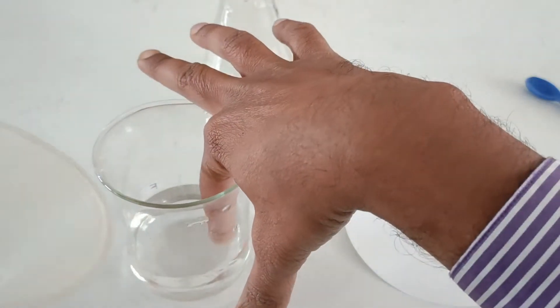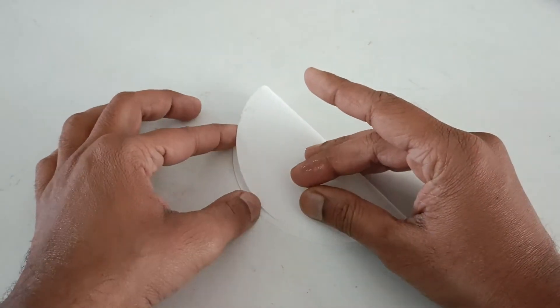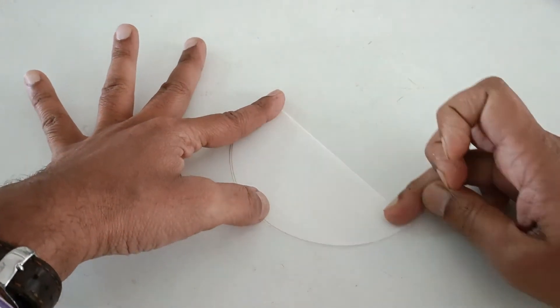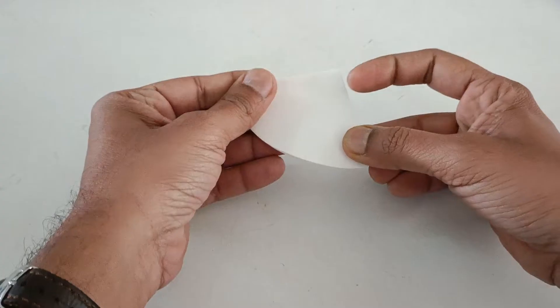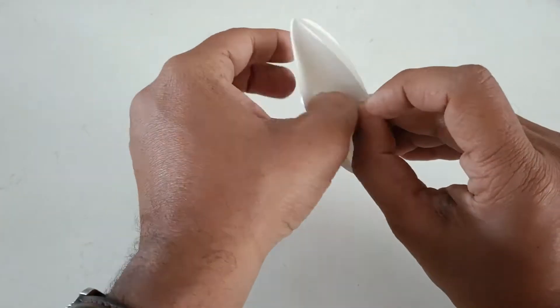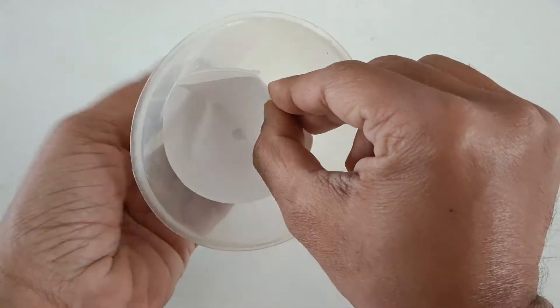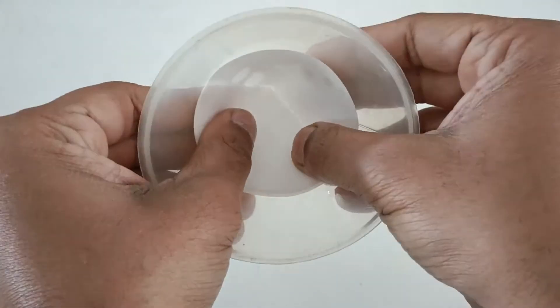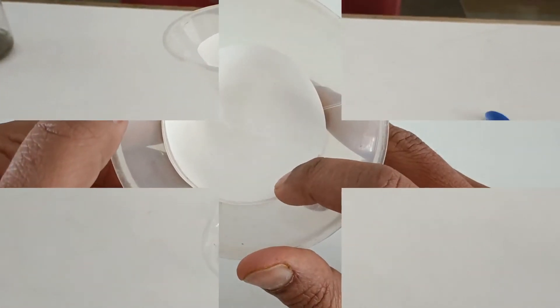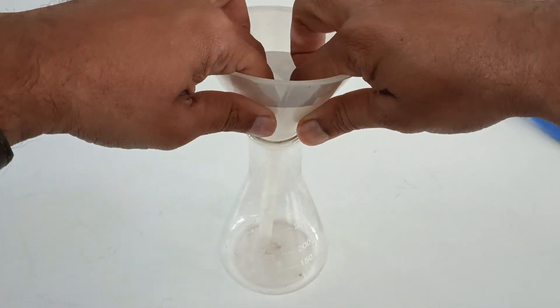Wet the inner walls of the funnel with water as shown. Fold the filter paper as shown and place it inside the funnel. Place the funnel in the conical flask as shown.